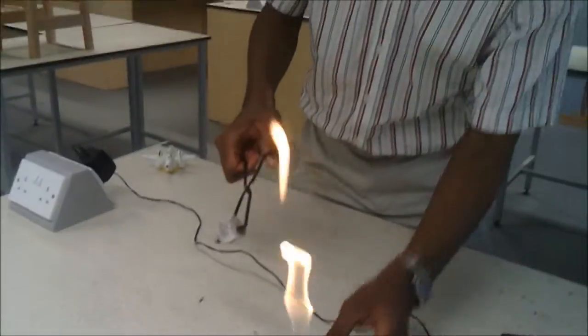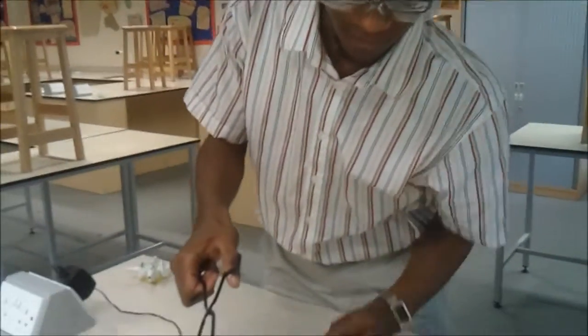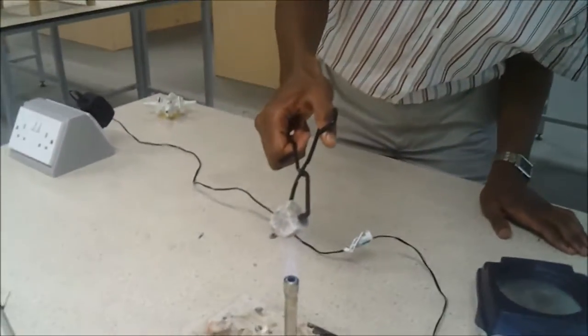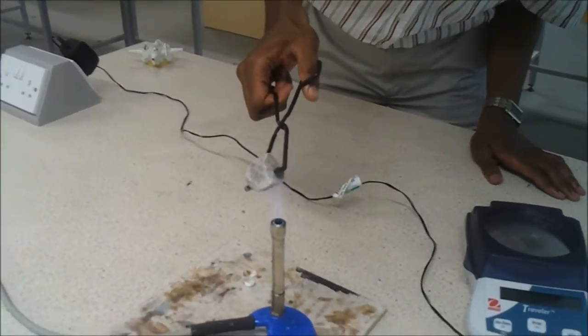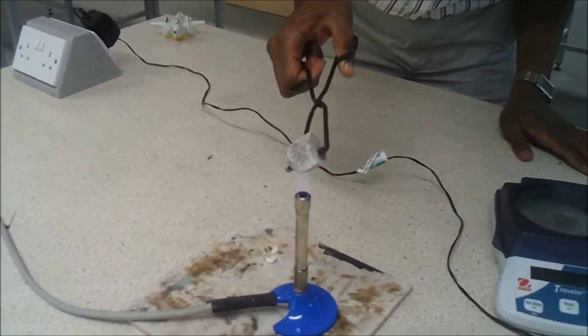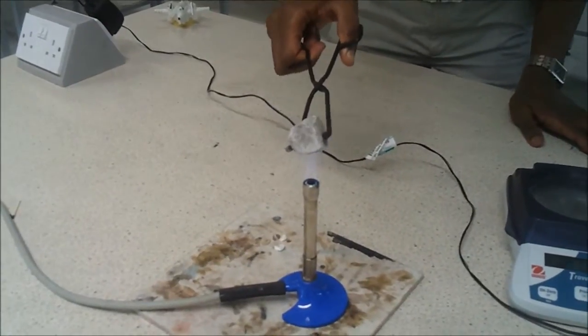And so now we're actually going to heat it under the roaring flame, just up at the top of that cone where it's the hottest part of the flame.